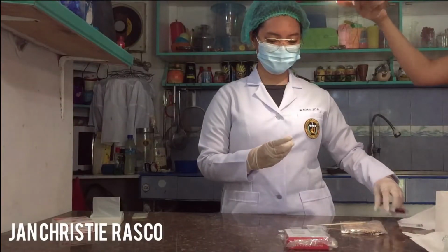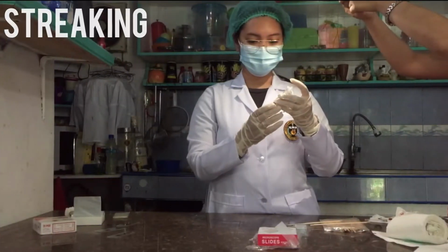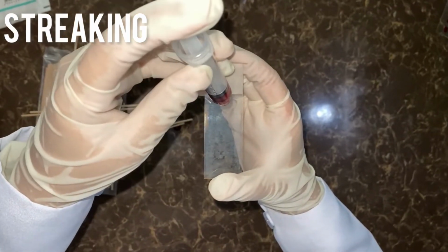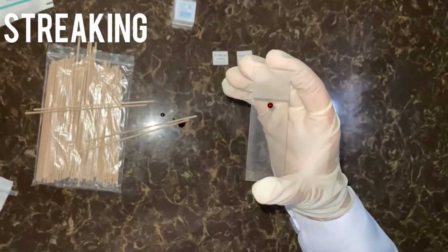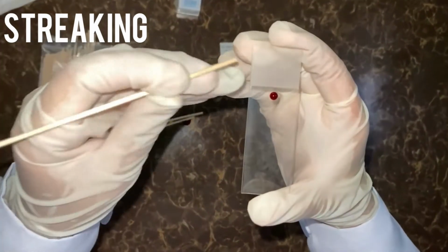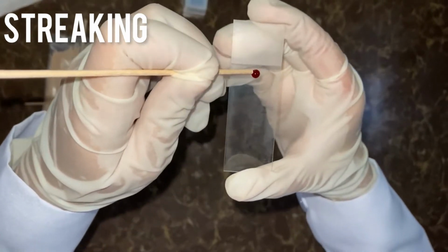We will now be performing the different techniques in smearing. Streaking. First step, pour a small amount of the sediments on one end of a clean glass slide. Second, using an applicator stick, streak the sediments in a straight or zigzag line throughout the remaining length of the slide.